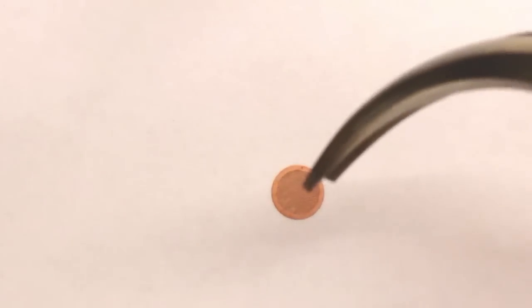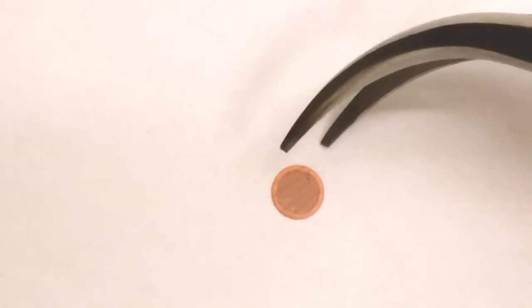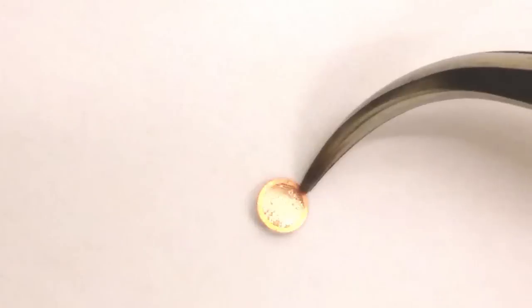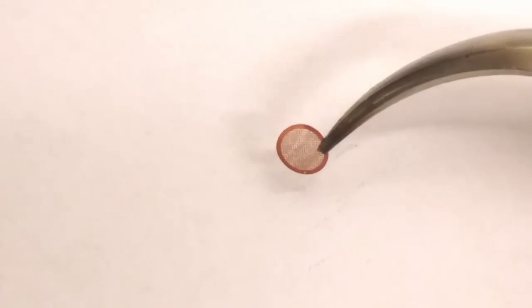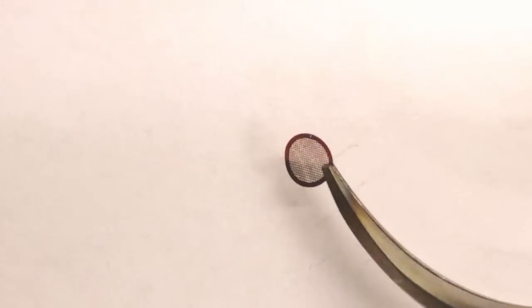Usually these grids are not only holes. Usually the holes is covered by some kind of film. Most commonly is a carbon film. This is how it looks like from the other side. One side is dull and the other side is glossy.